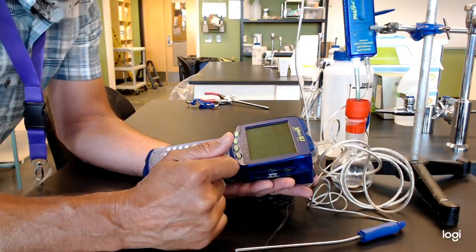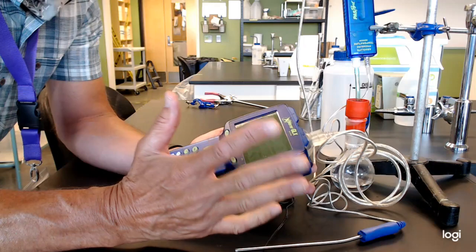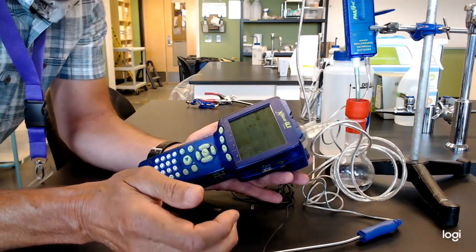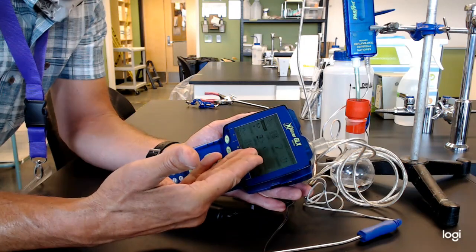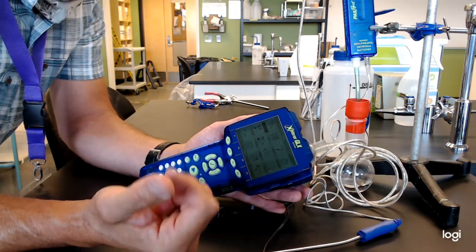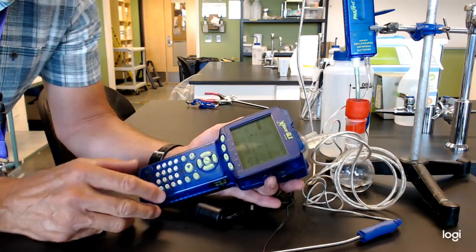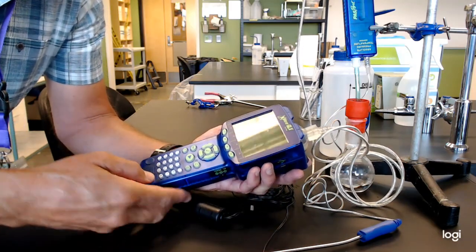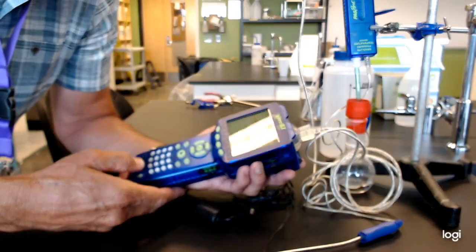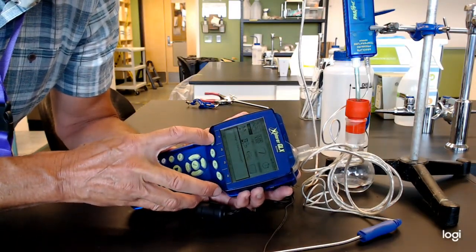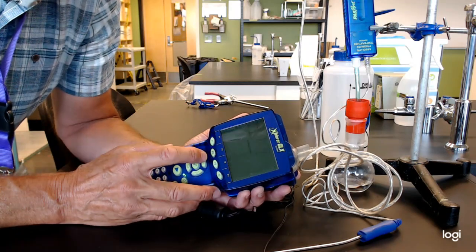But you can play with that and see how things go. So when it's time to turn them off, I pull the plug. Battery is working for a while. So you might have a little life. It depends which one you got a hold of. But when you're ready to turn them off, you just push the off button down here. And then it'll say, save changes to untitled. You can say yes. And away you go.